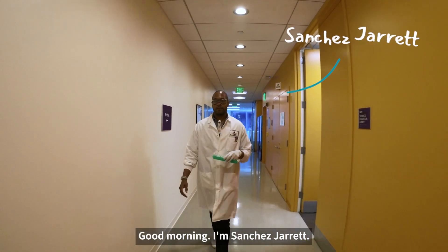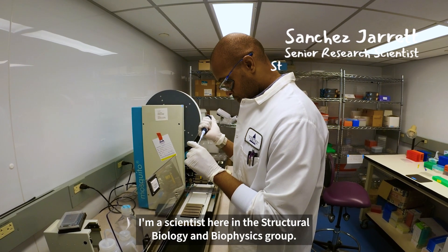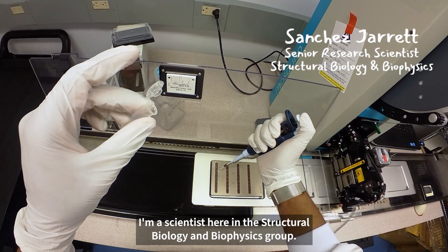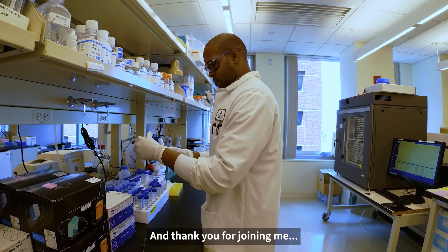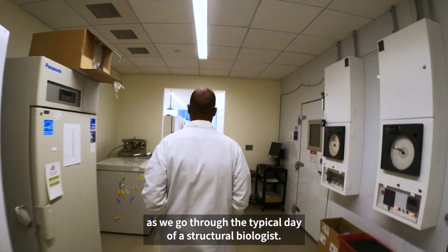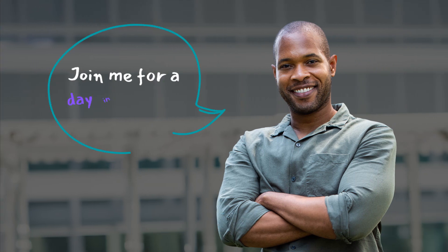Good morning, I'm Sanchez Jarrett. I'm a scientist here in the structural biology and biophysics group, and thank you for joining me as we go through a typical day of a structural biologist.